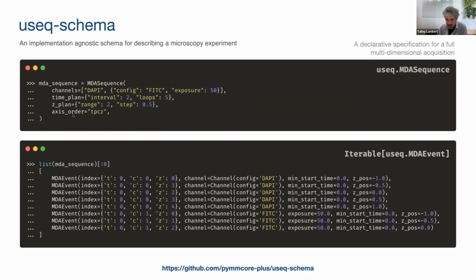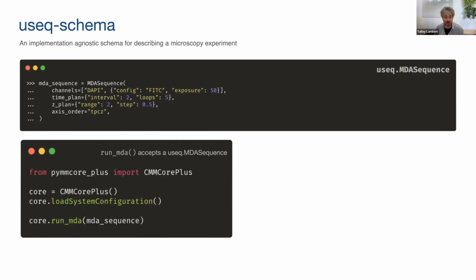And you can define an axis order to say what order you want the acquisition to go in. And the important bit here is that this object is itself an iterable of useq events. So if I call list on this object, and I'm just showing you the first 8 here, it actually pumps out a bunch of these events. And what that means is that we can pass that object directly to PyMM Core Plus's run MDA method. So again, now I'm back in PyMM Core Plus world, and I'm letting you know that PyMM Core Plus implements support for an iterable of useq schema MDA events. So it doesn't have to be this complex sequence object. It could just be a custom list of these events, but this here is an example of how to run a very basic multidimensional acquisition experiment using PyMM Core Plus and passing it an object from useq schema.